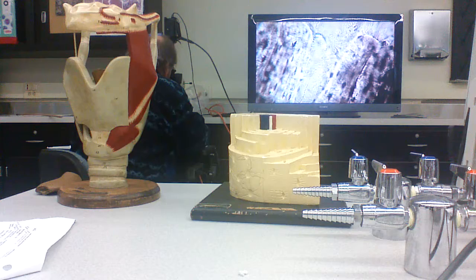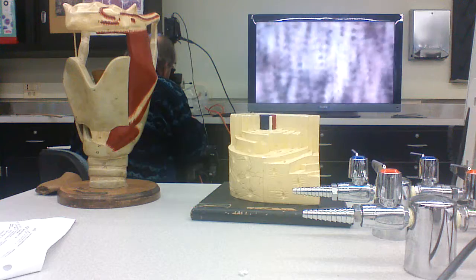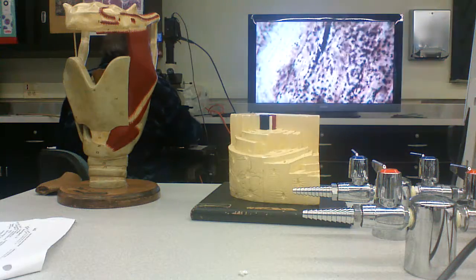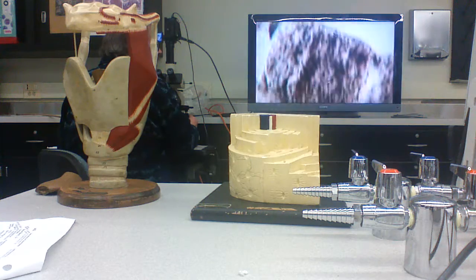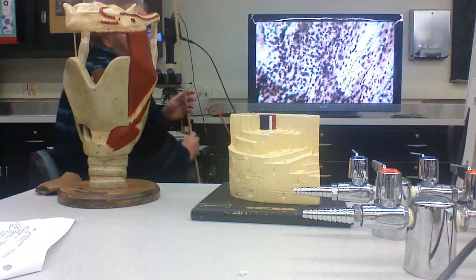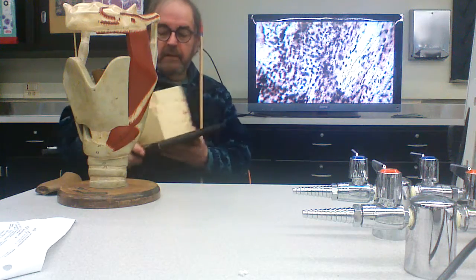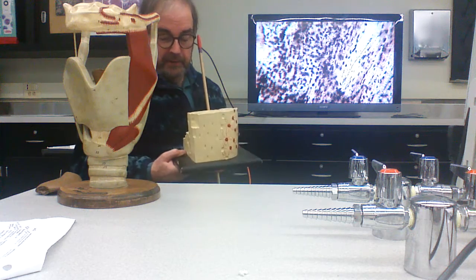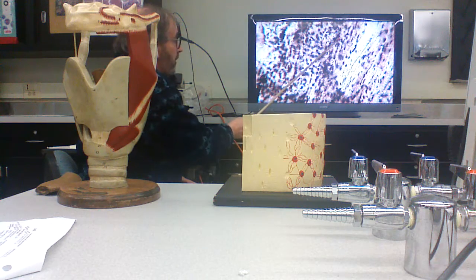Here's a piece of bone that's been polished in long section. So I guess I got magnification. You don't see the cylindrical network in the substructure. Instead, because you polished it in this plane, you can still see the osteocyte lacunae.